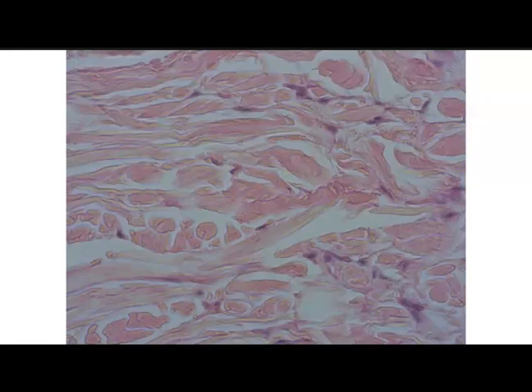Then we get into our dense connective tissue. The first dense connective tissue we're going to see is dense irregular connective tissue. Again, it's a kind of whirly pattern within the dense irregular connective tissue, and we know that dense irregular connective tissue helps with tensile tension in many directions. So this is an example of dense irregular connective tissue. We'll also see dense irregular connective tissue in the dermis, within the reticular layer of the dermis.